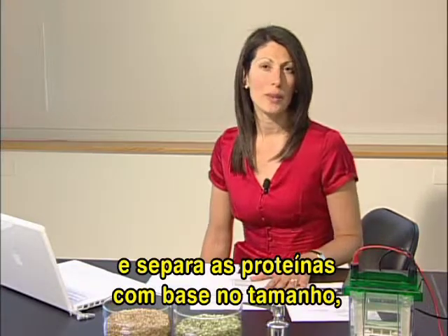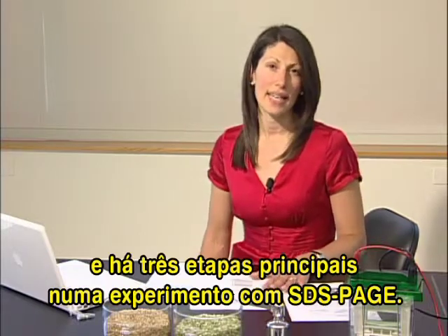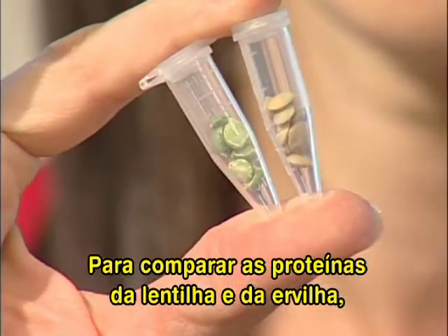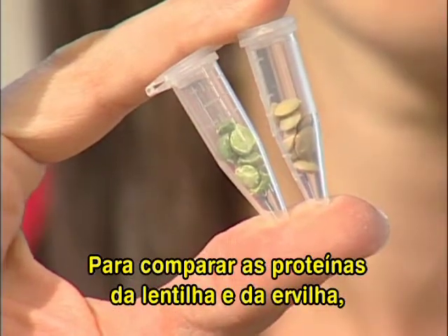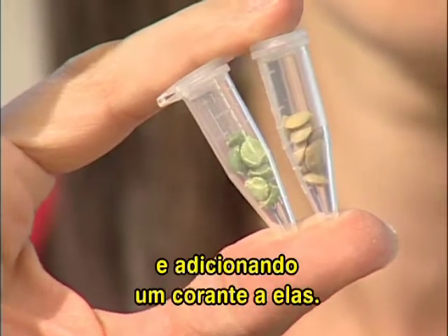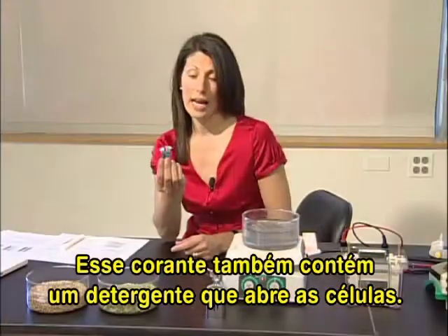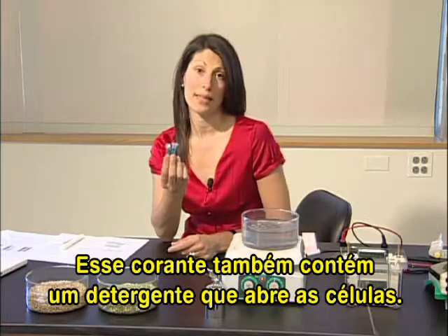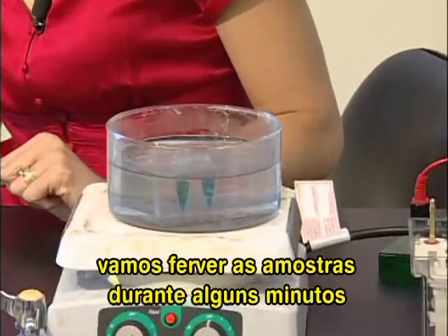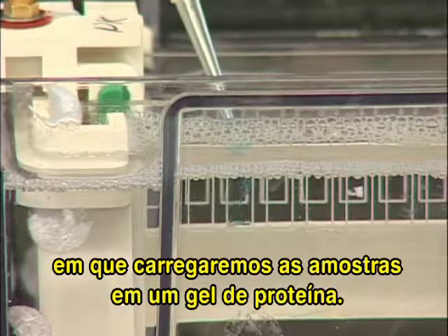It separates proteins based on their size, and there are 3 main stages to running an SDS-PAGE experiment, and we'll show you those now. So if we wanted to compare the proteins that are in the lentils and the green peas, we'd start by collecting some cells, some lentils and some green peas, and to these cells we would add some dye. This dye also has some detergent that helps break the cells open. To further break the cells open, we would boil the samples for a few minutes and finally move on to the next stage of the experiment, where we would load it onto a protein gel.